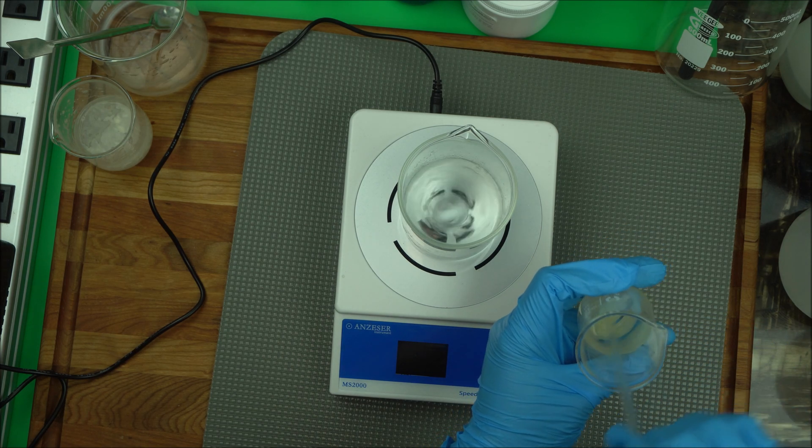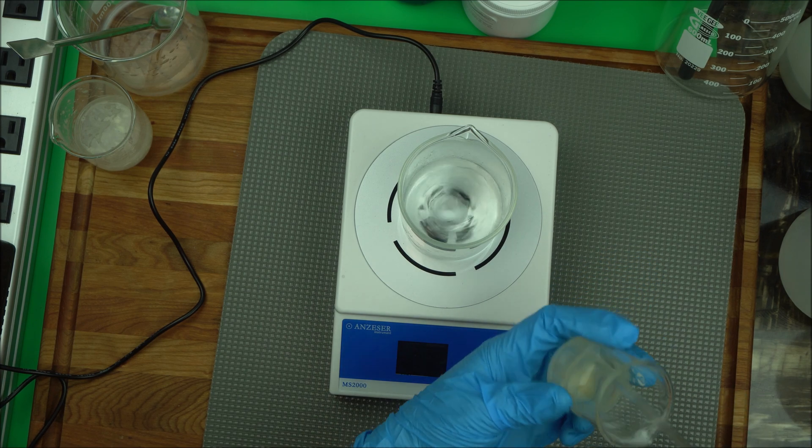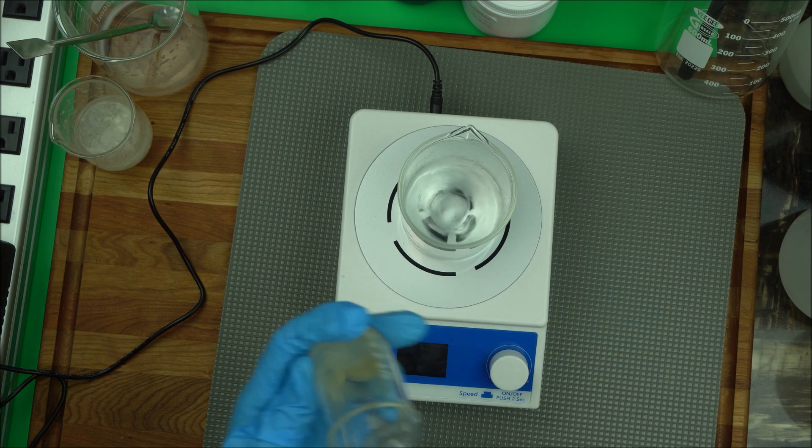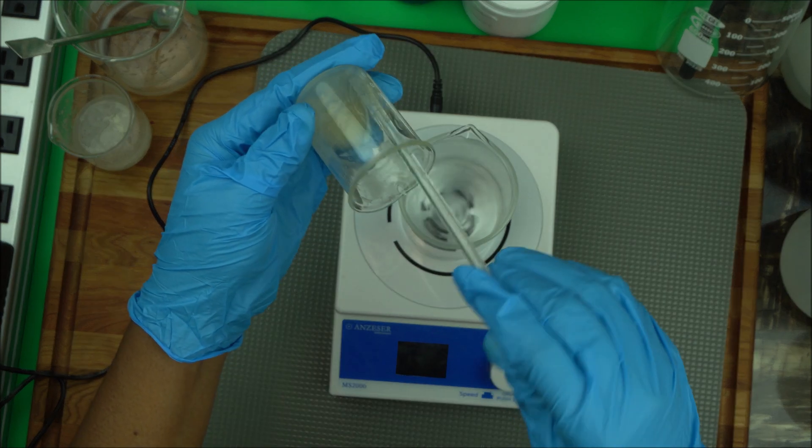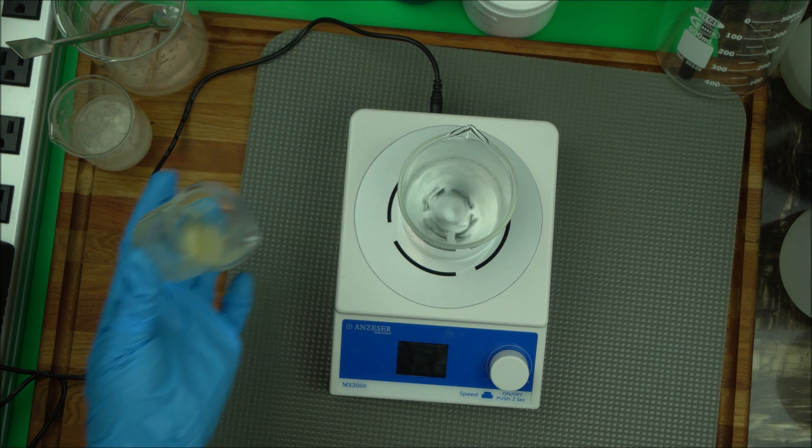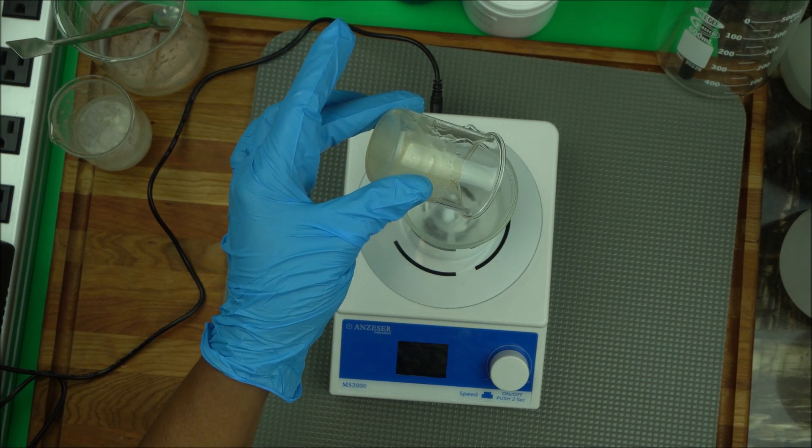Just dissolve the particles a little bit. That's the first thing you want to do while this is running. Then you're going to allow this to go. Make sure you throw it inside the vortex.